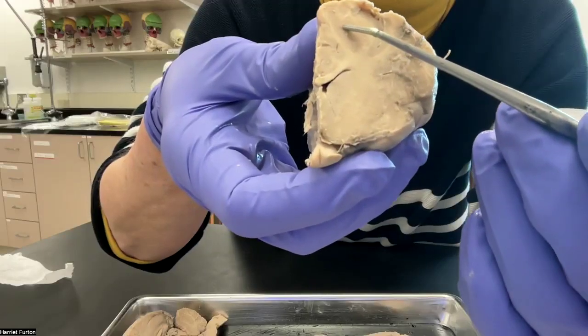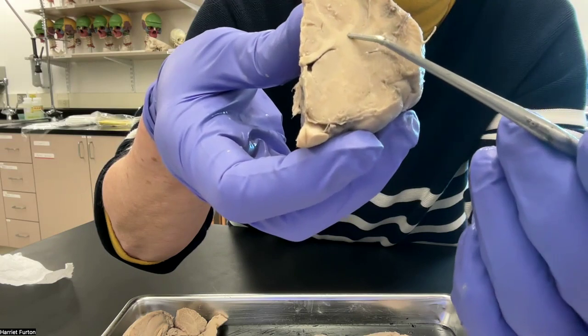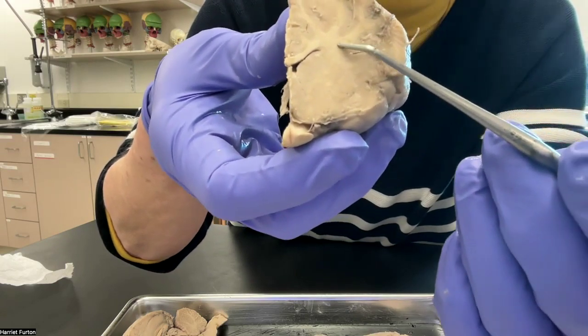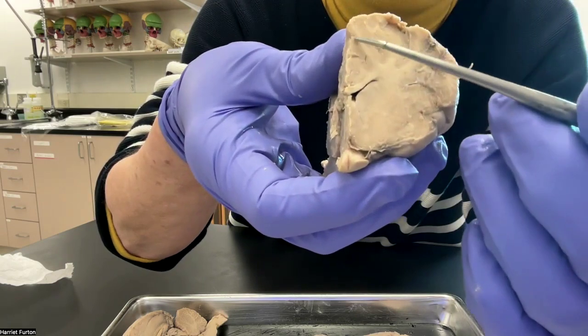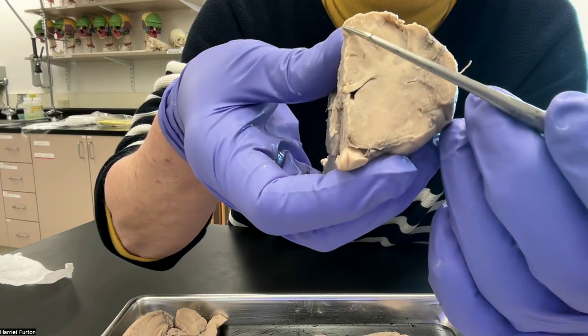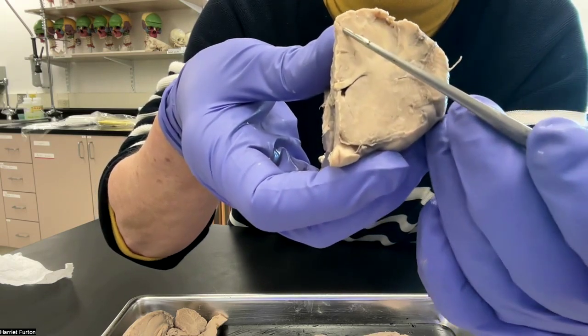On the cut, I would like to point out again, I don't know whether you see it very well, the gray matter. This is the gray matter and the white matter. The white matter contains the axons that are myelinated. We distinguish also in here the gyrus. These are the bulging out hilly parts of the brain.